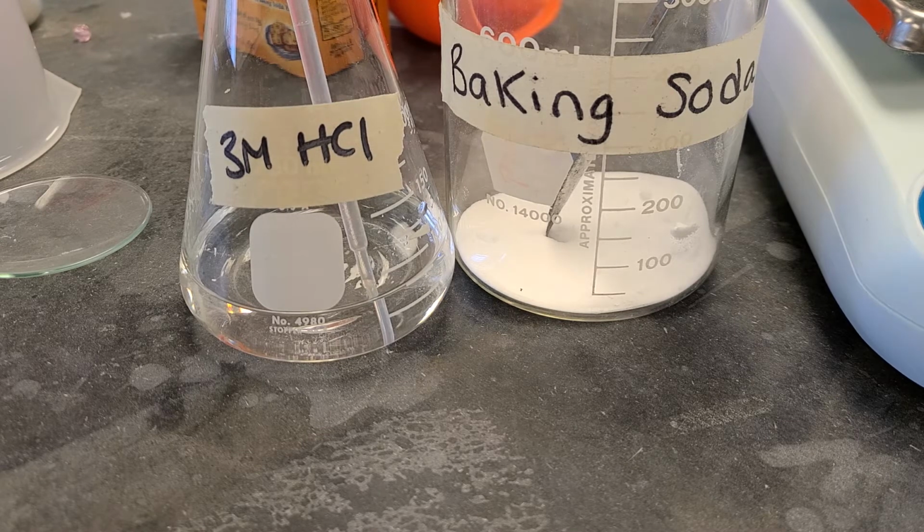So in this lab, we are manufacturing salt for the Wow Salt Company. Salt is the chemical formula sodium chloride, like table salt. That is what we're trying to get here.